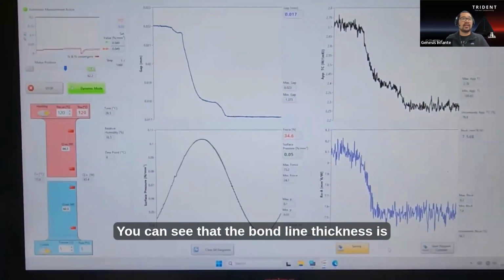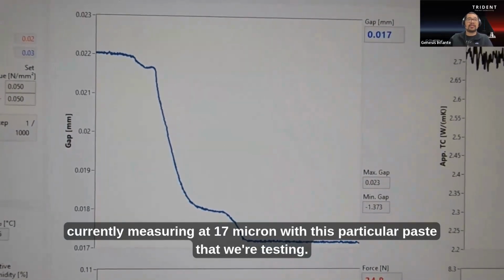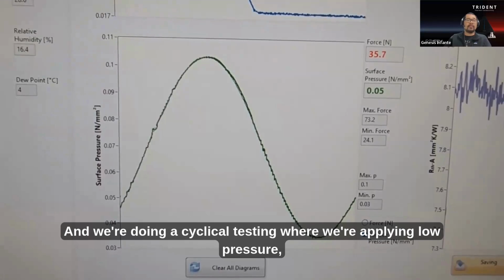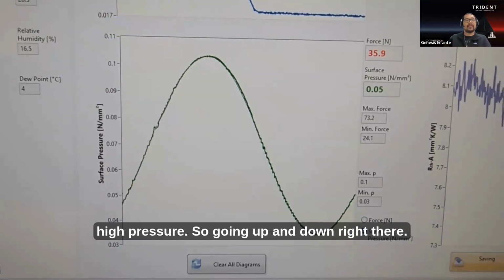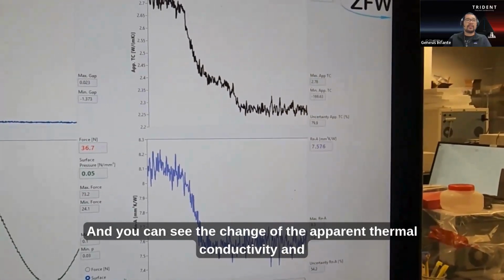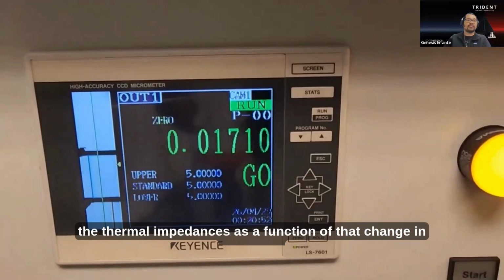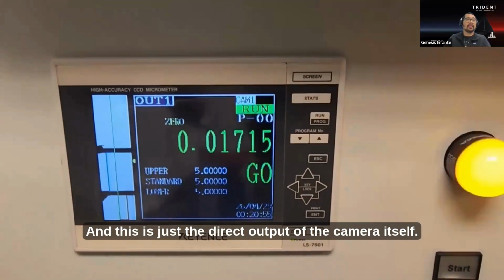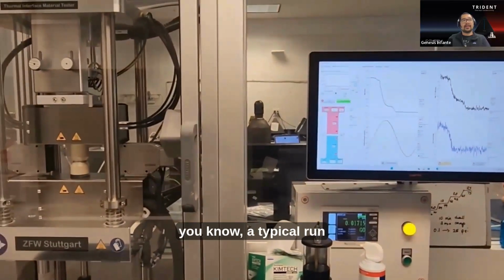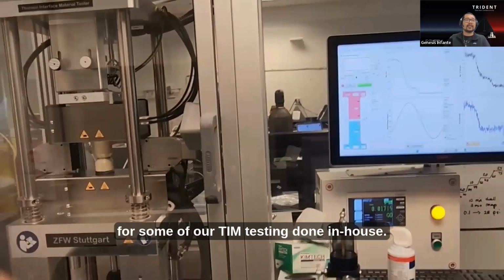You can see that the bond line thickness is currently measuring at 17 micron with this particular paste that we're testing. And we're doing a cyclical testing where we're applying low pressure, high pressure, so going up and down right there. And you can see the change of the apparent thermal conductivity and the thermal impedances as a function of that change in pressure. And this is just the direct output of the camera itself. So that would be what I would say is a typical run for some of our TIM testing done in-house.